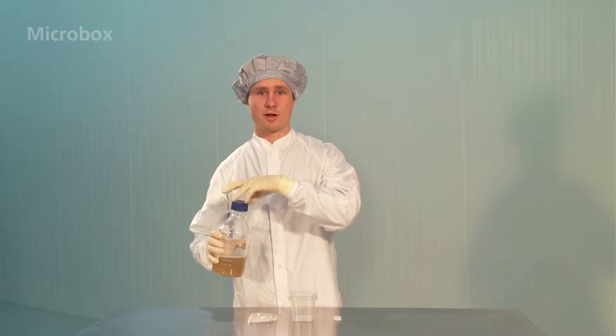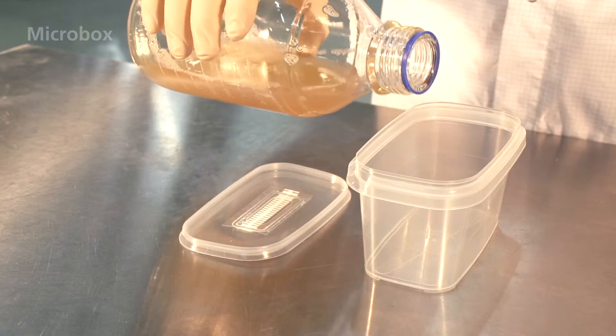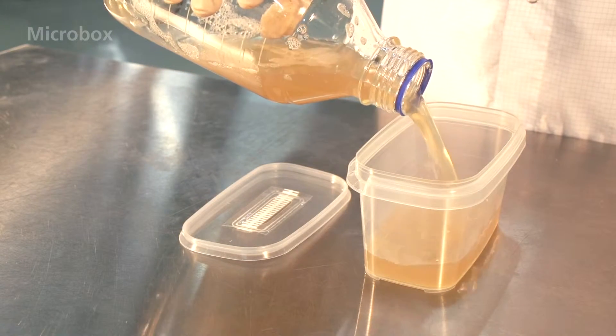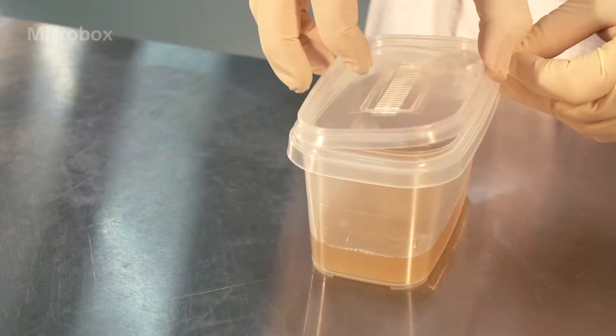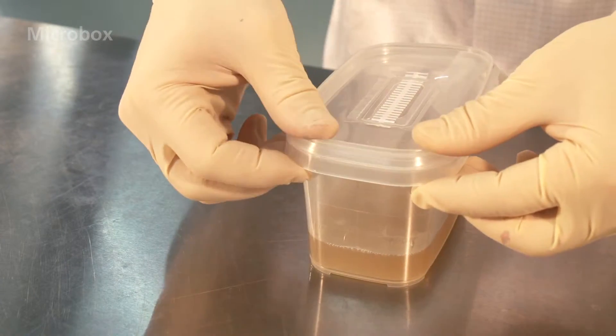For the second method, fill your containers under non-sterile conditions. But in this case, use a piece of non-woven fabric, place it over one corner, and snap the three other corners securely. This will prevent deformation of your boxes during autoclaving.